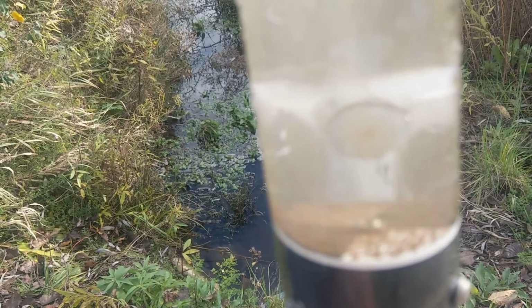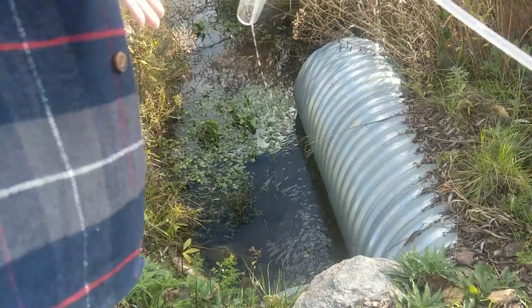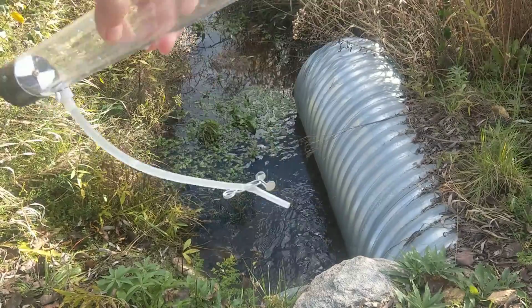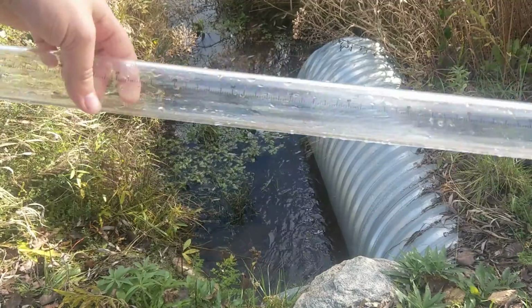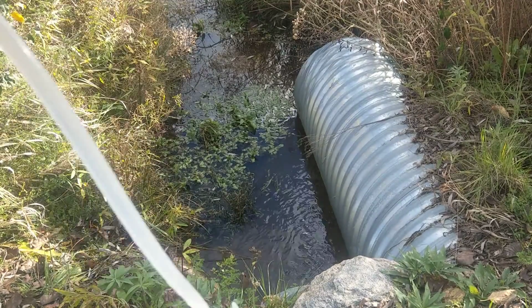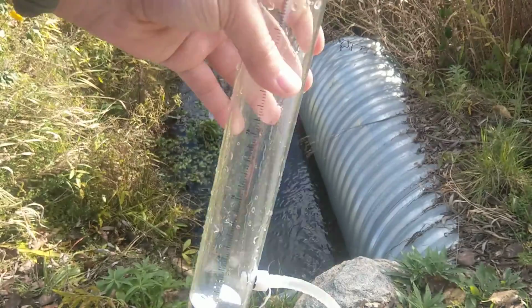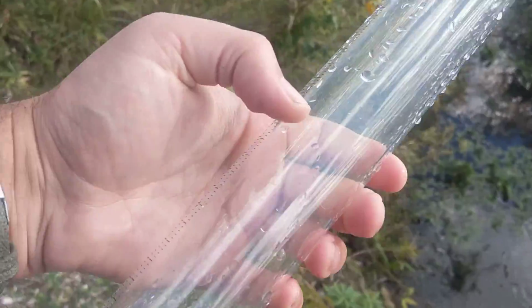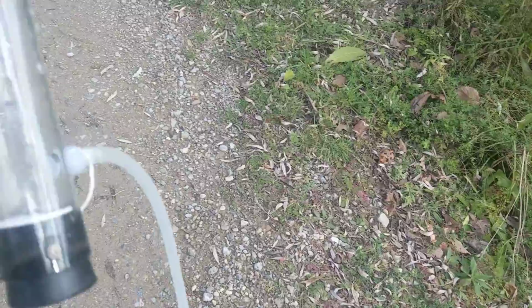As you can see over here, there's some dirt on the bottom, so making sure that you clean it after use is good. You'll notice the dirt is now gone, which is good. Making sure it's air dried so that there's no algae or buildup that happens. I would flush it with good water once you're back. That said, if you're using it the next day, a simple rinse with some nice water is totally fine. But if there's debris that gets in here, make sure you rinse that out, including in the tube itself.